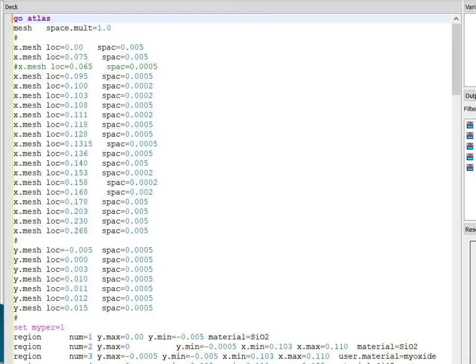Start from the go atlas. Next, the multiplying factor is 1 for the meshing. First I have defined the X meshing, then the Y meshing. X meshing starts from 0 up to 268 nanometers with different spacing limits. Please note down the meshing very carefully to obtain the optimized result. Next is the Y meshing, starting from -5 nanometers up to 15 nanometers with uniform spacing, that is 0.0005, or we can say 0.5 nanometer.